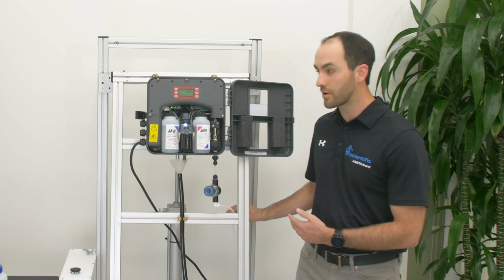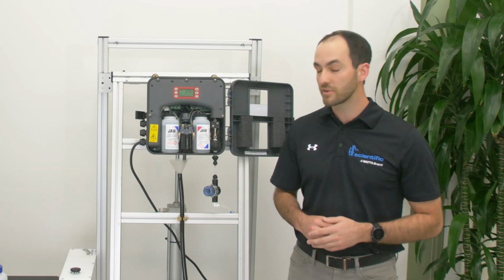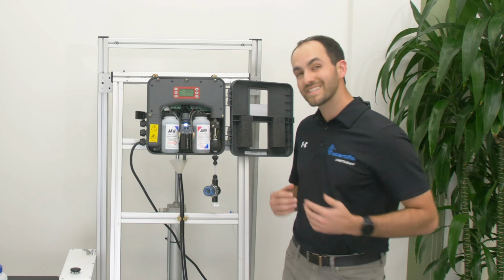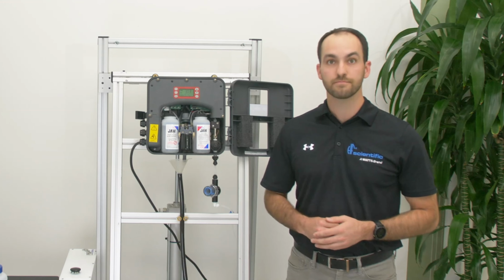We can see on this analyzer that we had a water alarm, and then we checked and made sure we turned our water on. As soon as we turned the water on, we should get the water alarm to go away as soon as the analyzer goes through its first sample cycle. We can see that there is now water inside the sample chamber, which lets us know that we have cleared the water alarm and the analyzer will start running normally again.